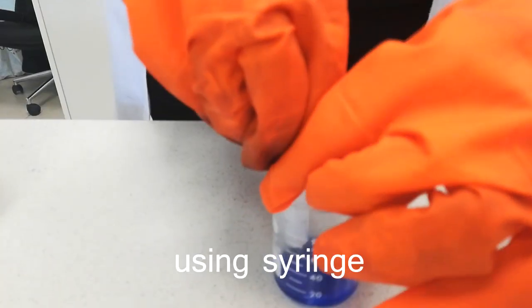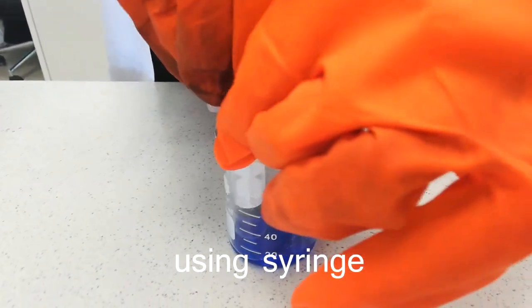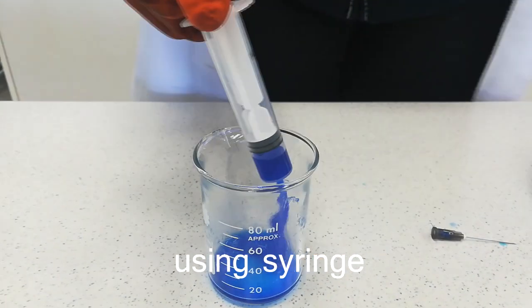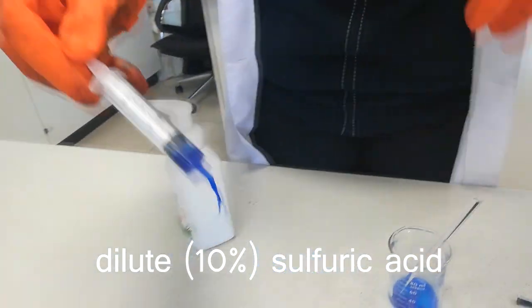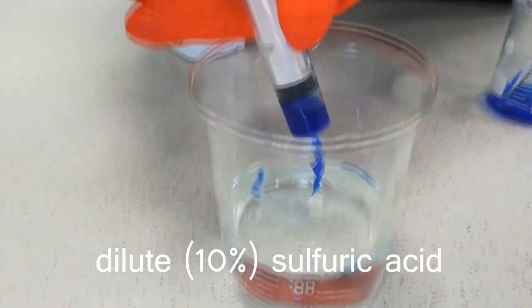Now that we have our solution of cellulose, we withdraw a few cubic centimeters of this solution and inject a stream of it under the surface of dilute sulfuric acid solution. A thin blue rayon fiber will form.